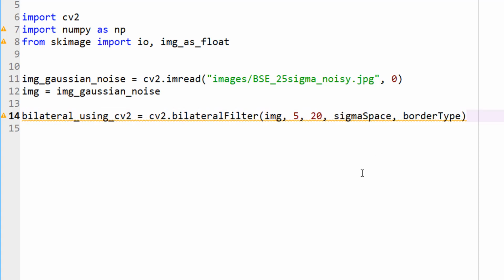One thing you have to realize here is OpenCV deals with numbers as unsigned integers. So when I type 20, this is like a value of 20. Now, apparently under scikit-image, it converts your image into a floating point automatically when you call this function bilateral. So the values would be between 0 and 1 when it comes to the sigma color. But when it comes to the spatial, you still have the spatial value, numbers in pixels, right? So this is 714 by 901 pixels. So let's get there in a second.